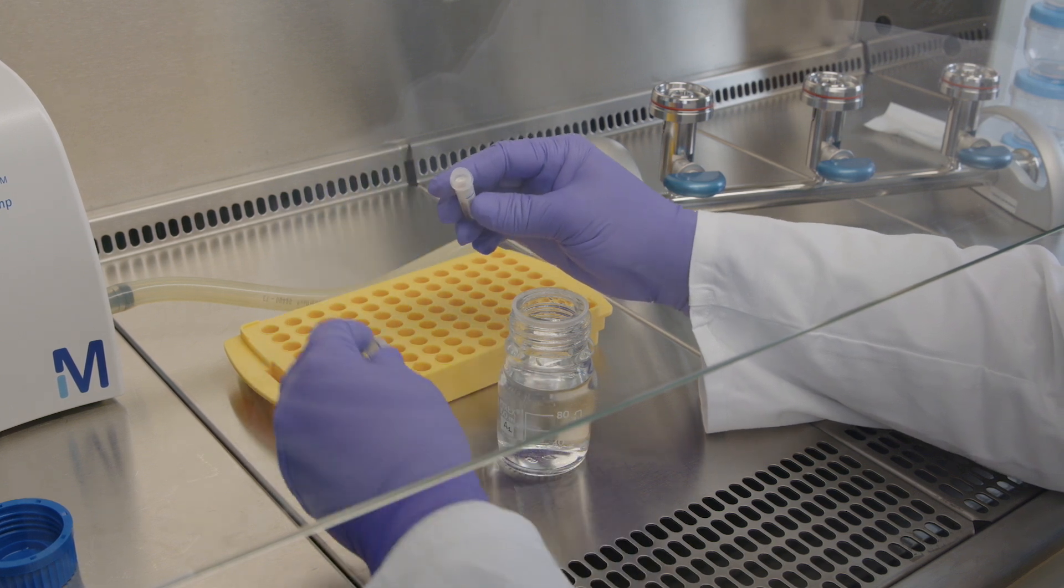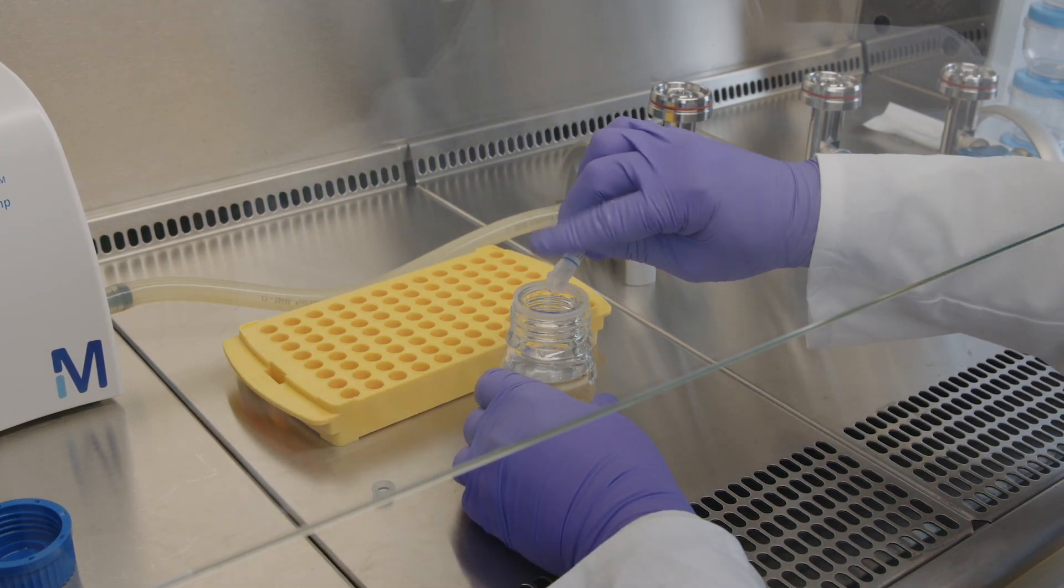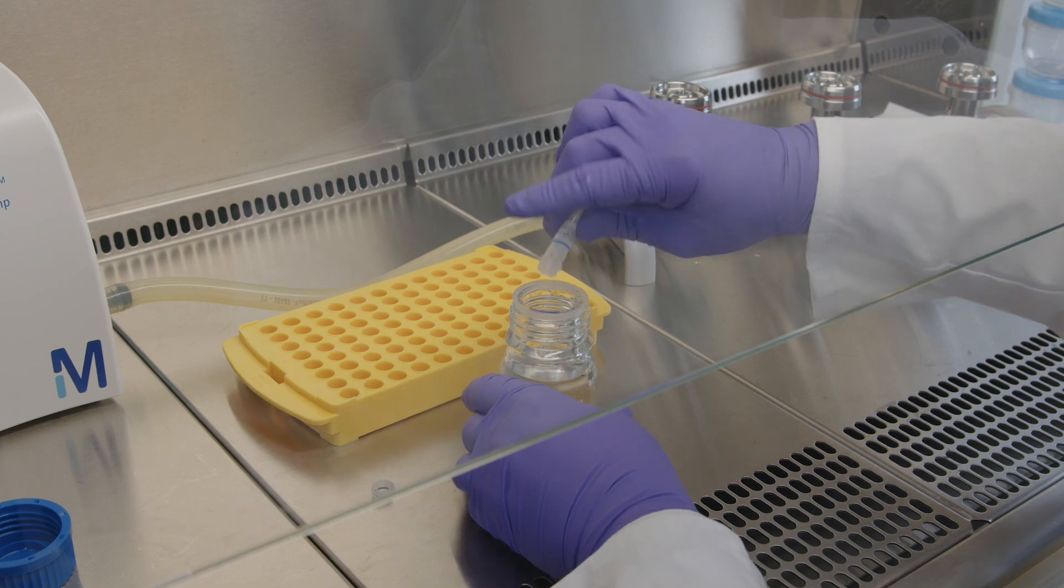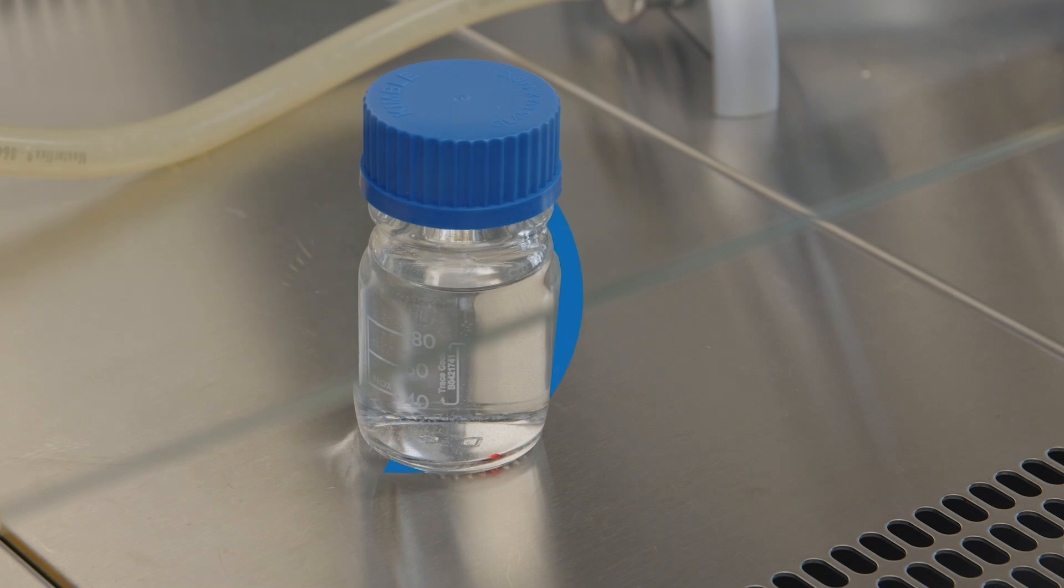Take a vial that has reached ambient temperature. Open it and drop the disc into the buffer, diluent, or sterilized tap water. Shake gently and leave inoculated liquid at room temperature for 10 to 15 minutes.